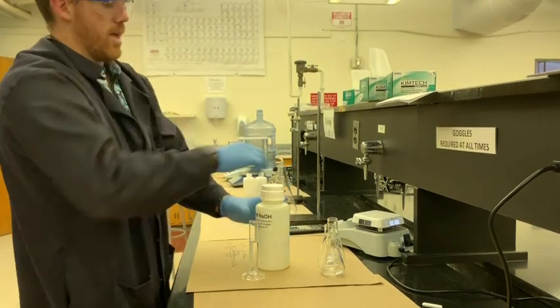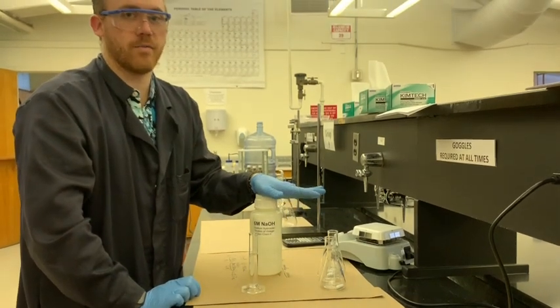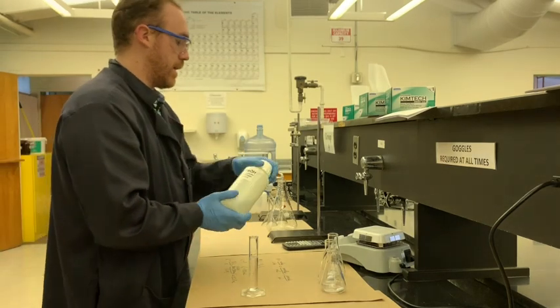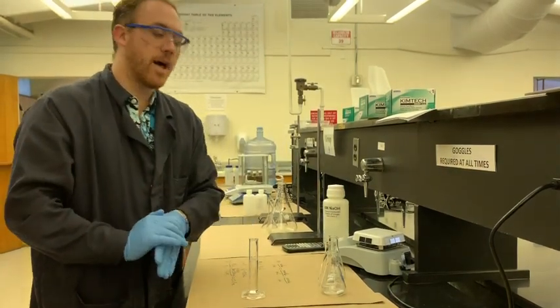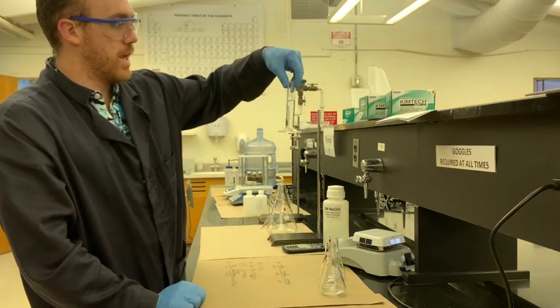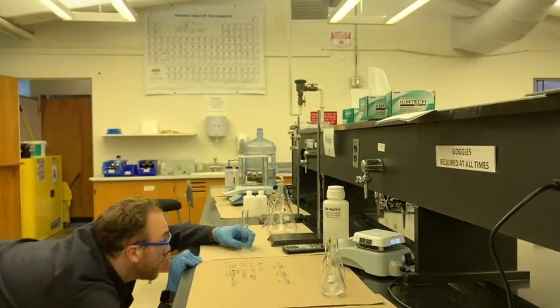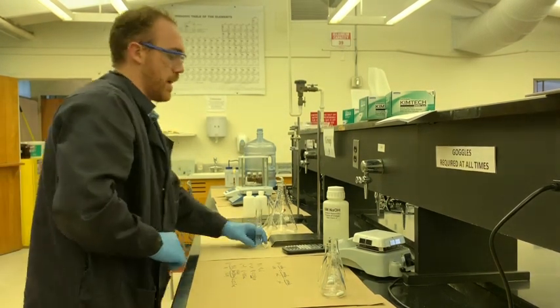The main hazard of NaOH, by the way, that you should be very careful about, is that if it gets in your eyes, it can cause serious burns. So try to do whatever you can to keep it off your skin, and wash your hands with a lot of water if you get any on your skin. All right, so we have 20.8 milliliters. It appears we probably have technically 21.2, so I'll make note of that.